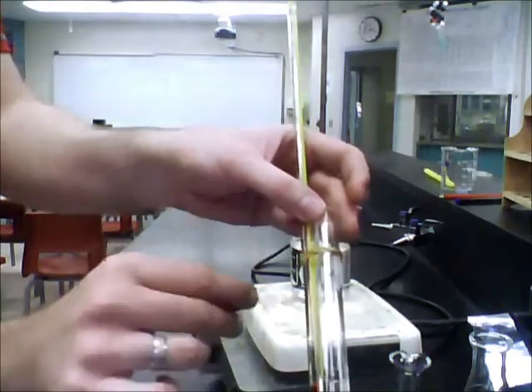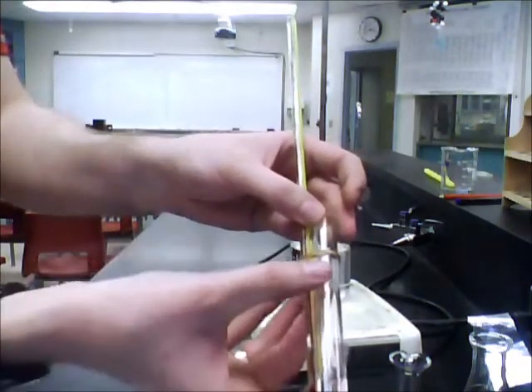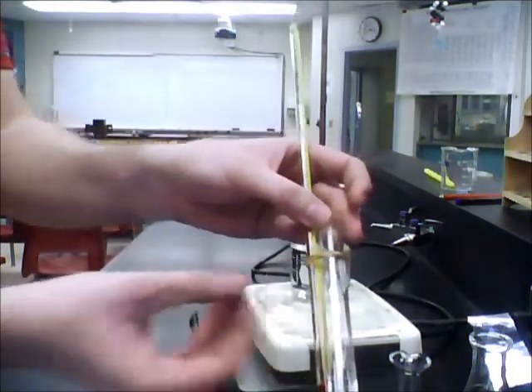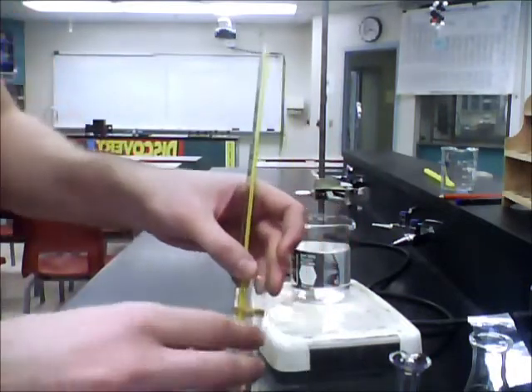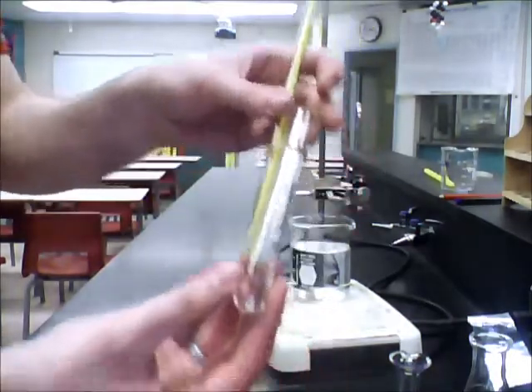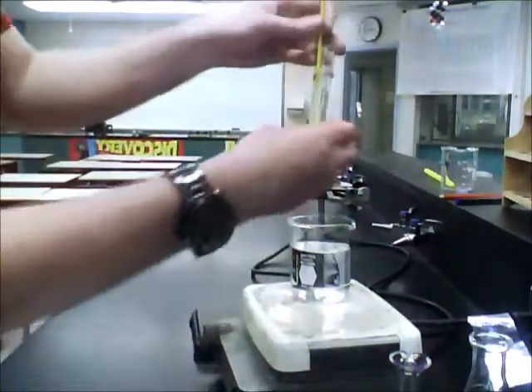Now be very careful when you're tying the rubber band to both the test tube and the thermometer that you're not making it so tight that it's going to break, otherwise it's going to shatter and you're going to have a really rough time doing this lab.